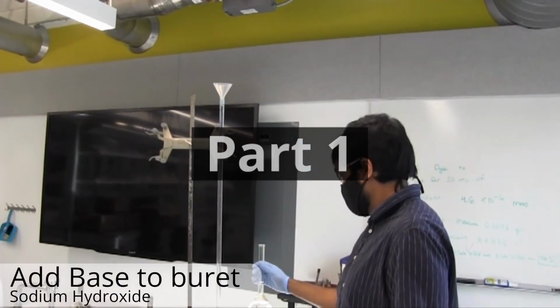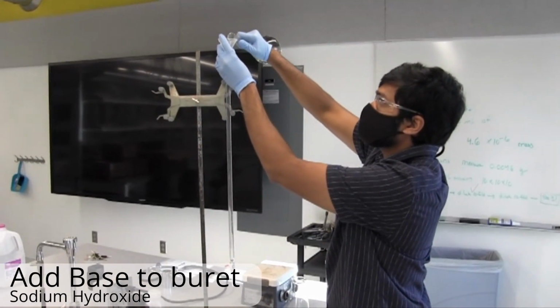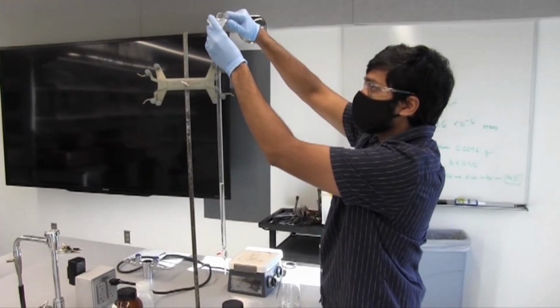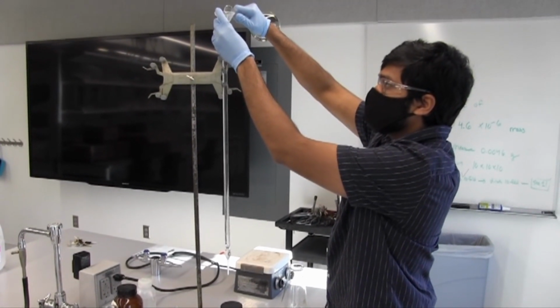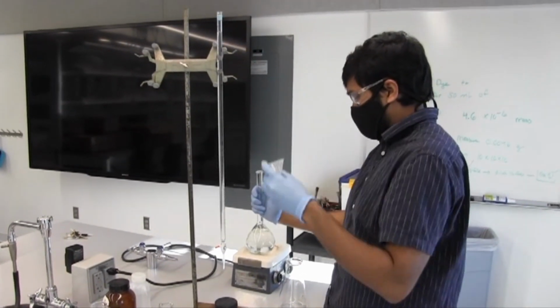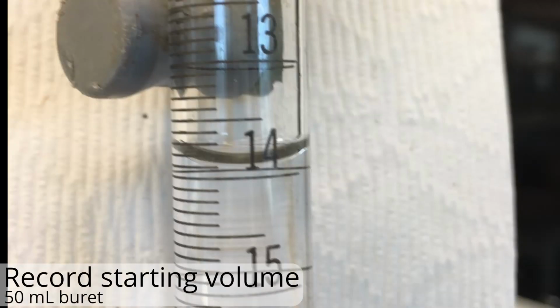All right, so for part one, we're going to start by adding our base, our sodium hydroxide, into our burette. We're going to try to fill it all the way to the top. Now this burette can hold a maximum of about 50 milliliters of liquid, and we're going to try to get as much as that can. The important thing about this burette, as mentioned, was that it's backwards. So our recording volume is going to be 14, as you see here.